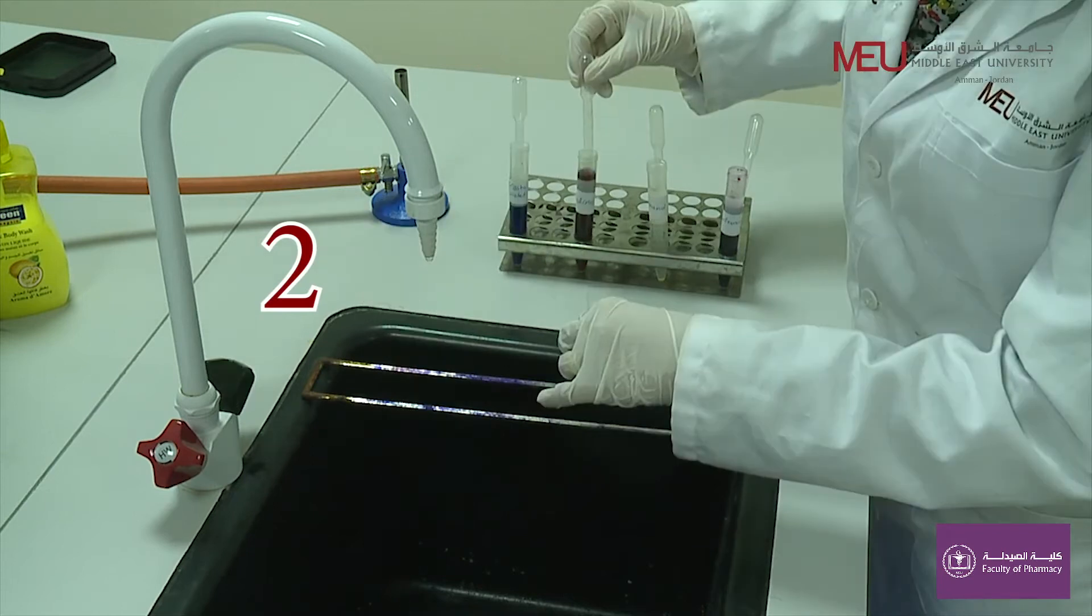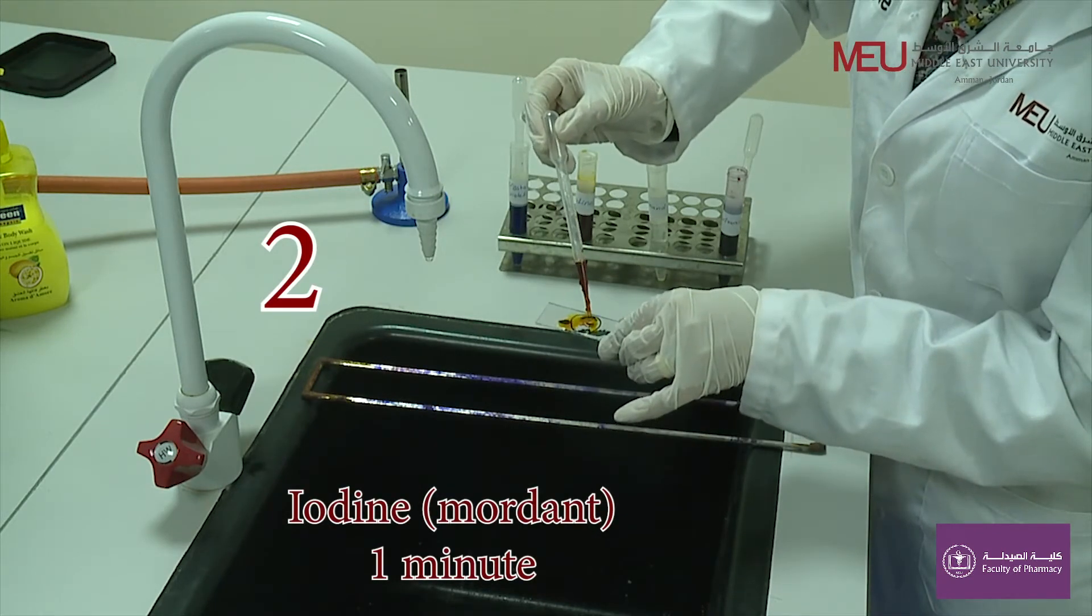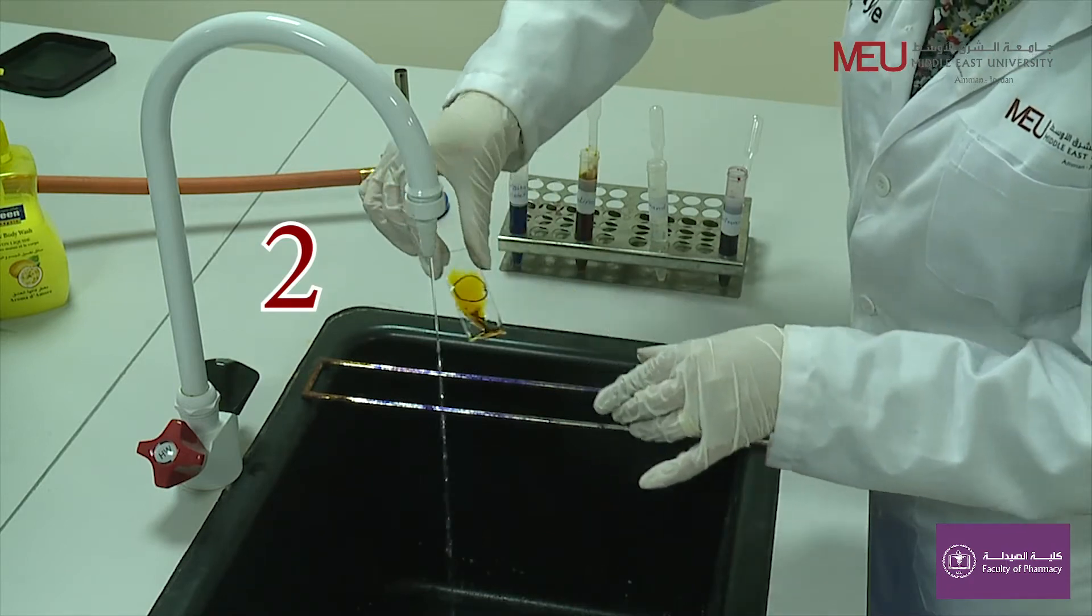Step number two includes flooding the smear with iodine solution for one minute and then rinse again with water and shake almost to dry.